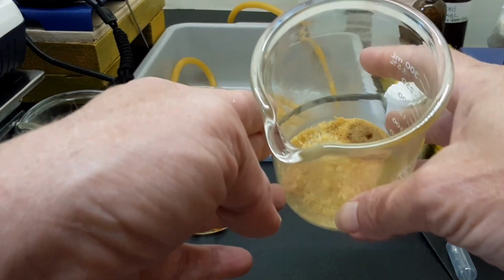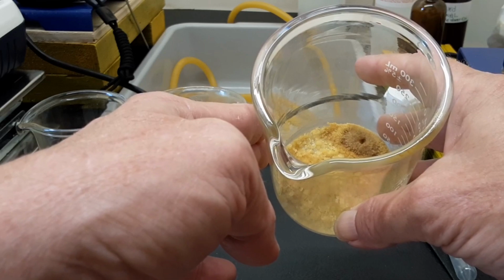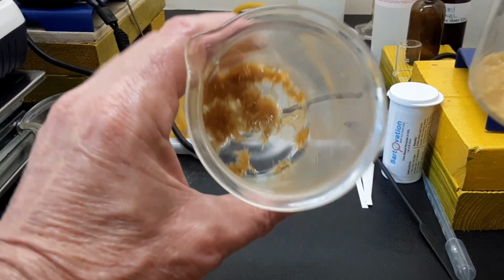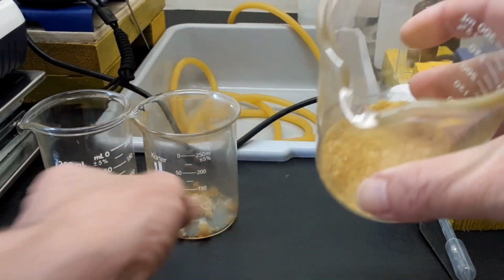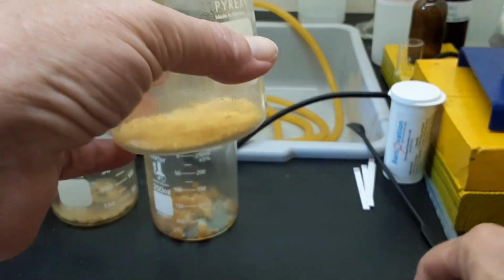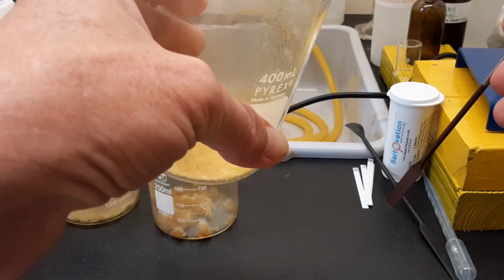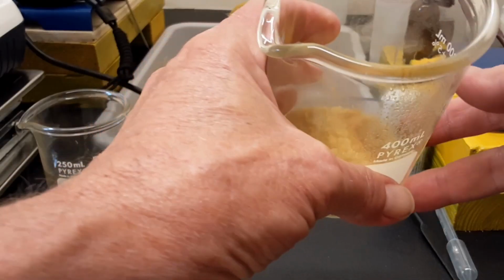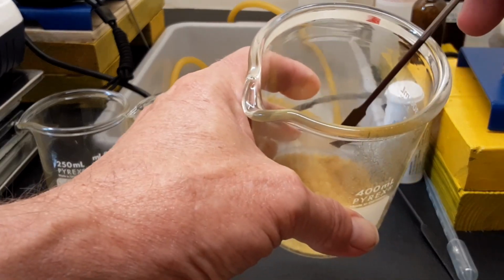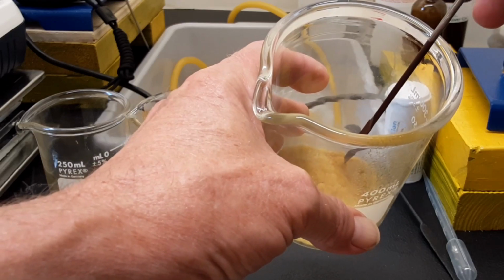Now when this came out into the funnel filter, this here looked like a clump of greasy peanut butter. It had basically the same color as this did, but this looked more granular. This formed a big damn greasy ball that you couldn't take a spatula or a spoon and separate from itself. Almost like a piece of mercury. It just rolled around in the funnel filter, and if you squished it, it didn't stick to the glass. It just rolled off the glass.